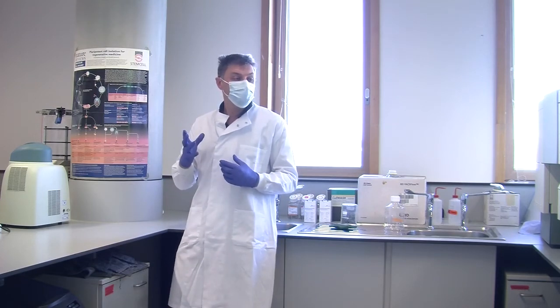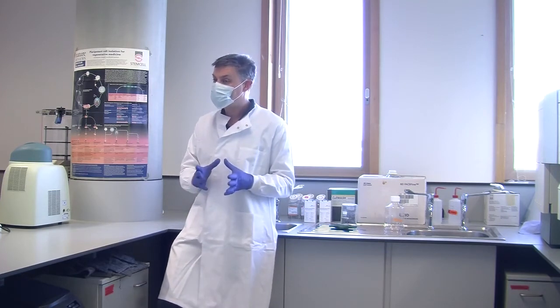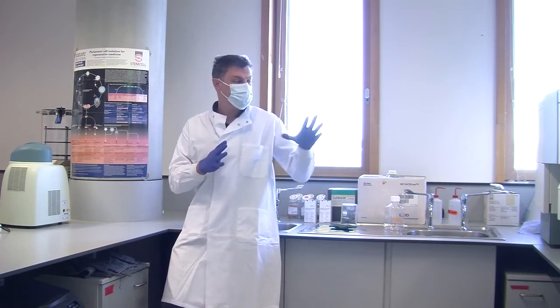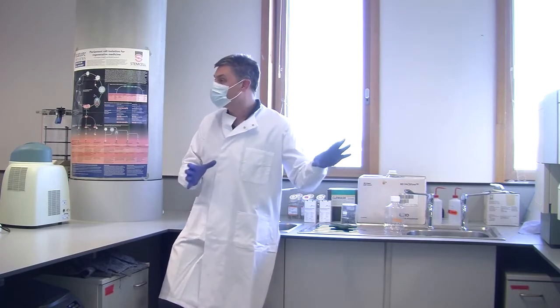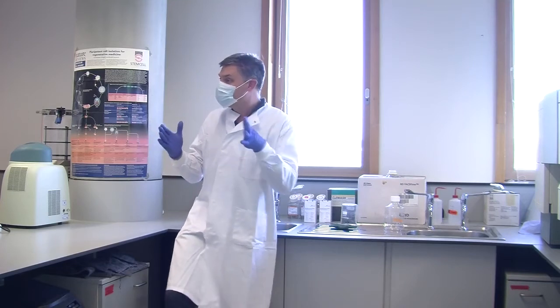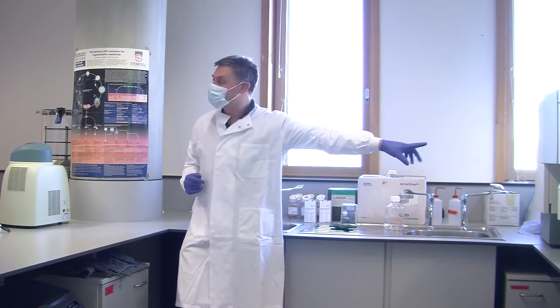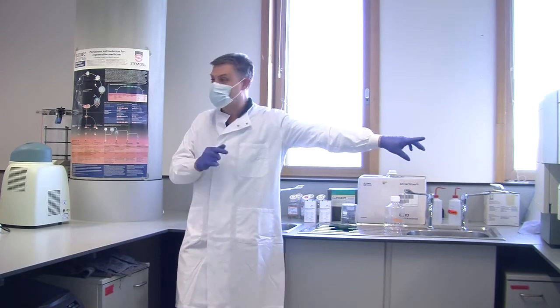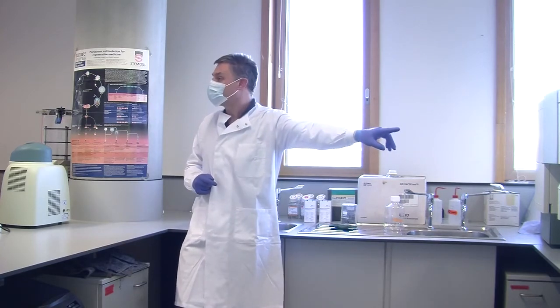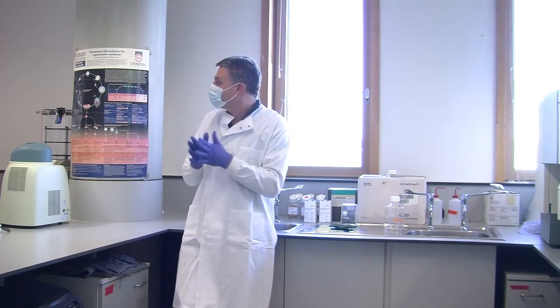So it's an amazing technique to understand, but the problem you get both with flow cytometry and many other modern techniques is it's all a black box. And you will see this if you're doing a whole range of techniques. You put the cells in the tube there, you press go, dots come out here. Well, what are those dots? What do they mean? How do you interpret them? And that's part of the problem.